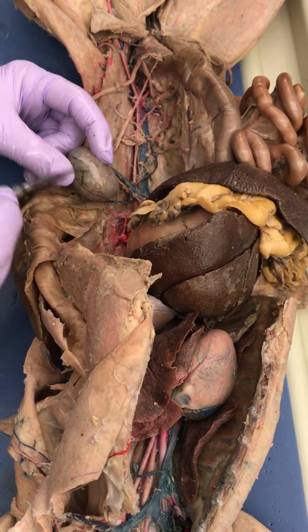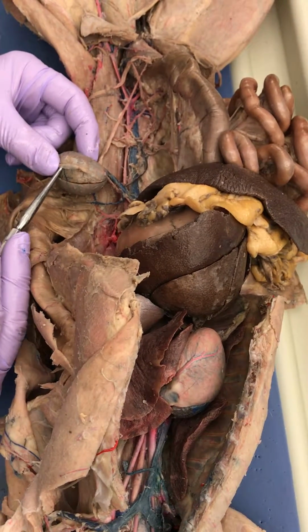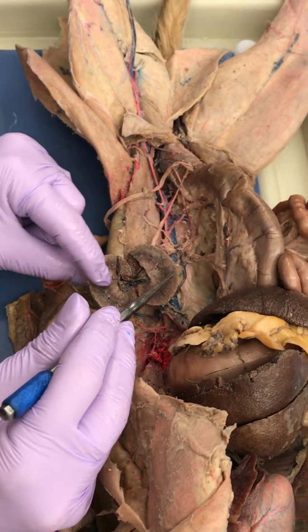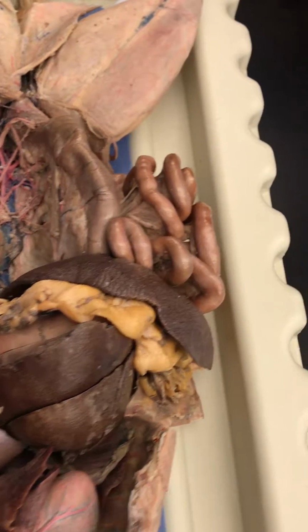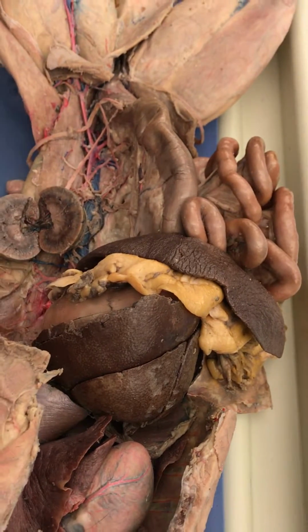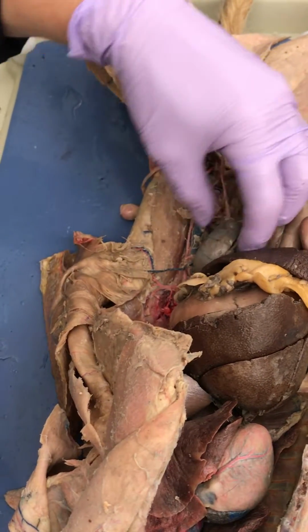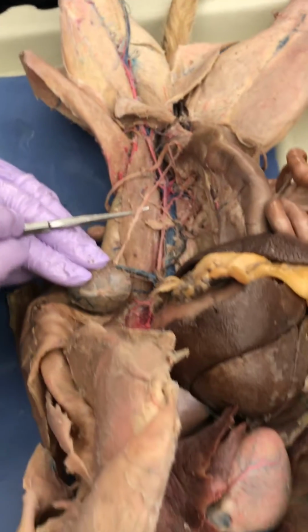Like this. The capsule. Now we're going to need renal capsule. Renal capsule. Okay, how about now? It's the renal cortex. Medulla. Renal medulla. Renal pelvis. Good on the kidney? Okay. Oh, one more. Ureter.